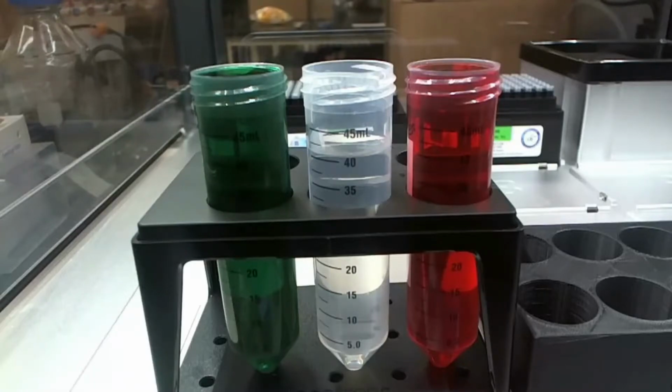Okay. So now we need to see what this thing returns. We can get back out the source volume, the new destination volume, and whatever volume is remaining. We remember we talked about the pipettes themselves, right? If I switch over to the presentation, I have a picture here.